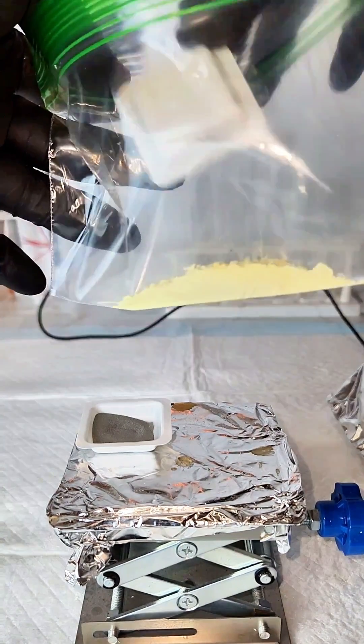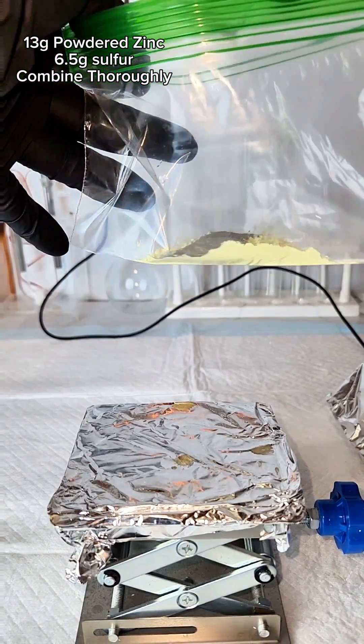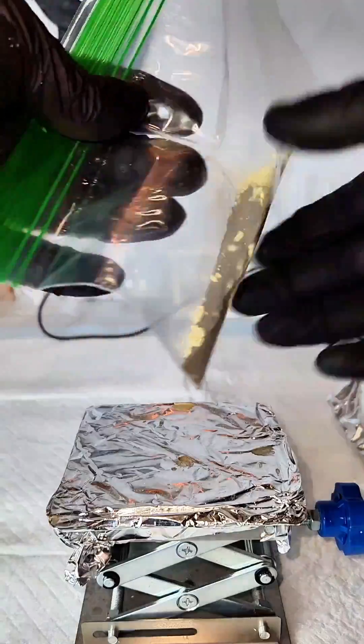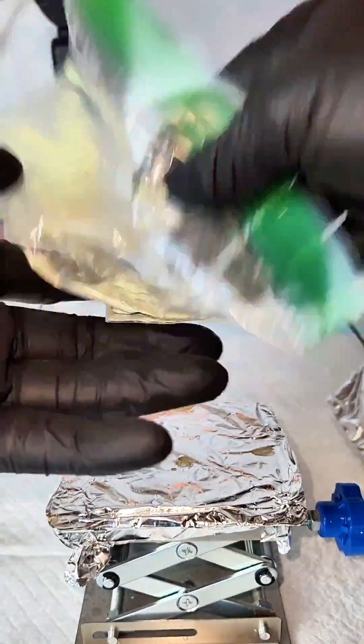Conducting this reaction is really similar to thermite, and all you have to do is combine stoichiometric equivalences of sulfur and zinc metal. When catalyzed by exposure to high heat, these two react aggressively like you saw at the beginning of the video forming zinc sulfide.